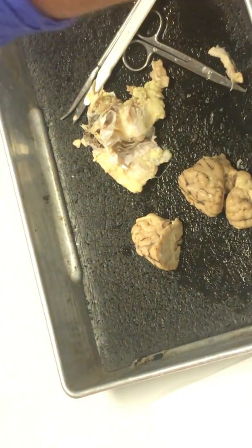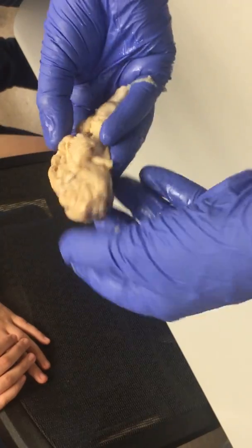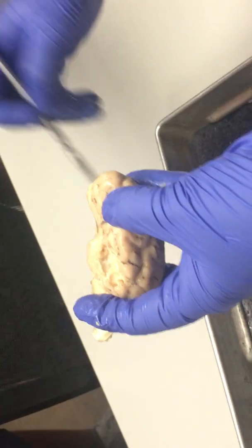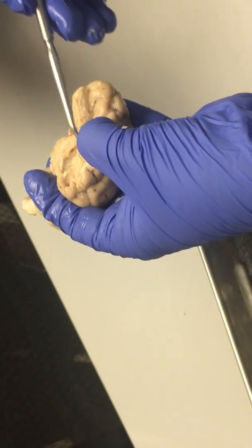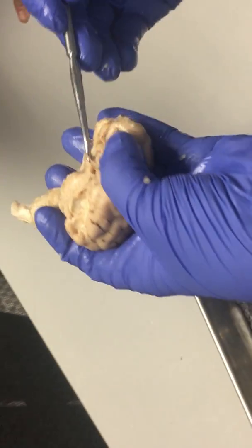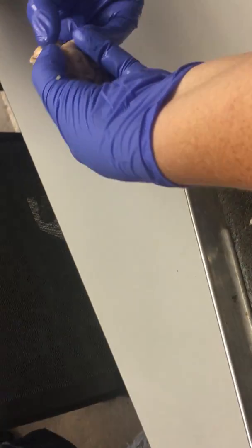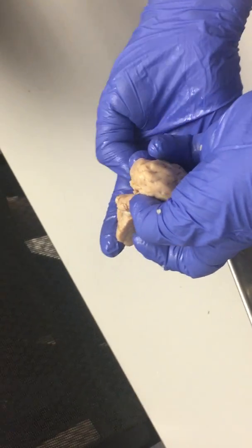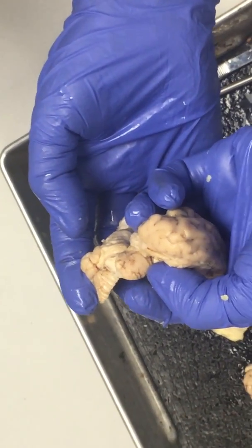The other thing we were talking about is how hard it is to figure out which is the central sulcus. I got nothing — it's around here somewhere. The lateral sulcus is this line here. What about the insula? Here's the lateral sulcus — if I cut through here, we should be able to see the insula; the insula would be in there. Those little nubbins right there — that's the superior and inferior colliculi. Nubbins is a technical term.